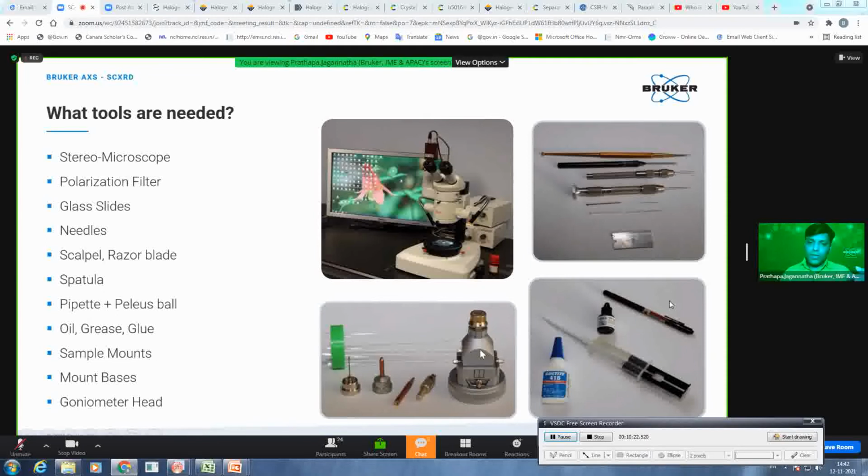So the goniometer head now comes with a magnetic base, which is ideal because you don't disturb your goniometer setup too much. So this will always be fixed onto your diffractometer. You just play with this crystal cap, putting it onto the magnetic base here and then taking it from there. Otherwise, previously, every time you were tightening this grub screw, after some time this grub screw loses its strength, and then you are collecting data which has a lot of vibration or movement in the crystal, which is not good.